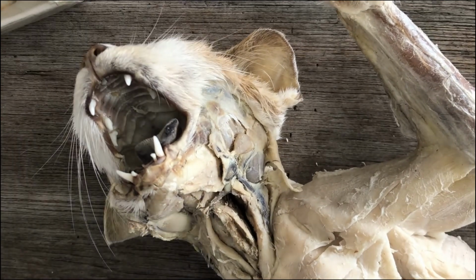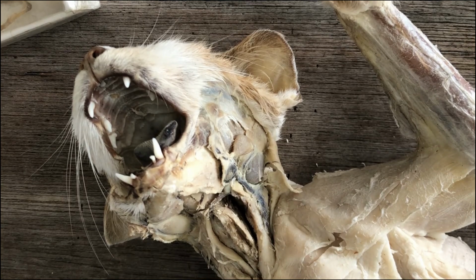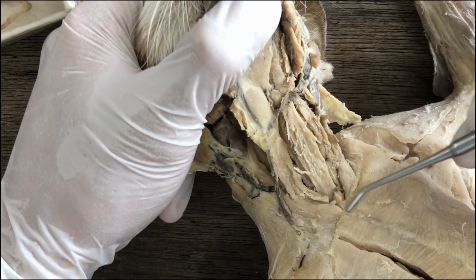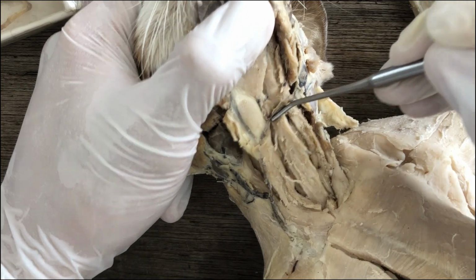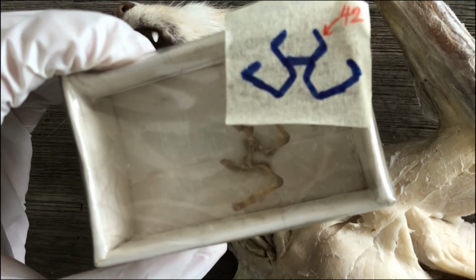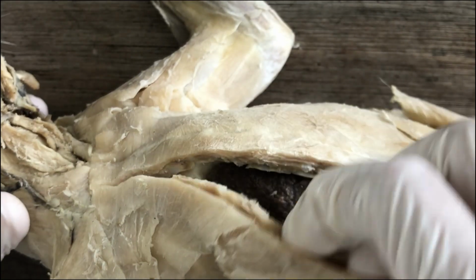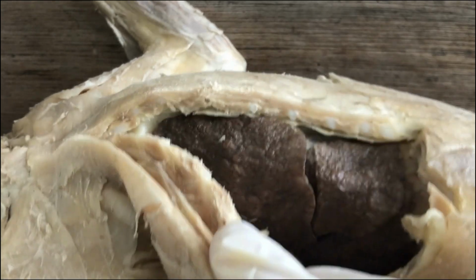So the hyoid bone serves to mainly support the tongue and also serves as an attachment for neck muscles like your sternohyoid. You see, from the sternum attaching somewhere here, because this is the location of the hyoid bone. And that's it. That's the last structure you need to examine in the oropharyngeal cavity. Coming next, we open up the pleural cavity and look at the structures contained inside.